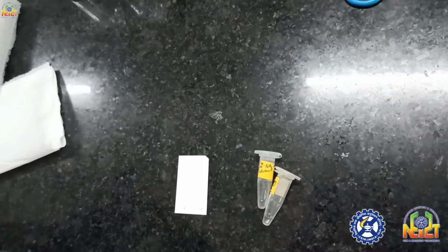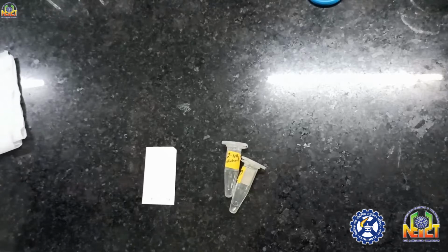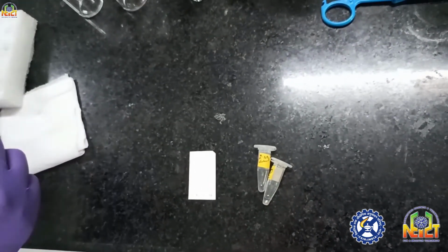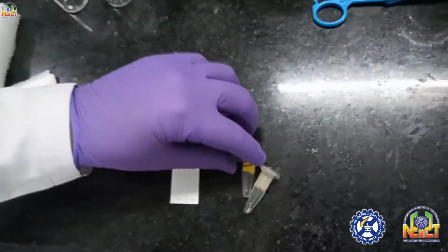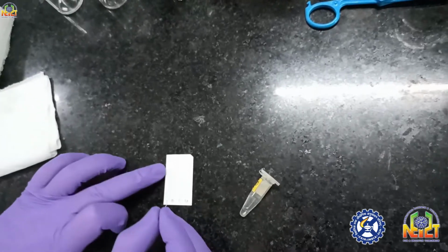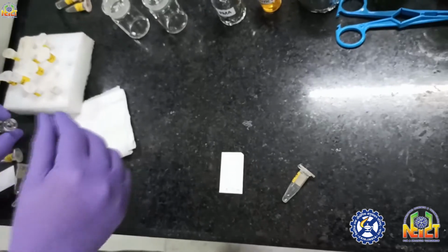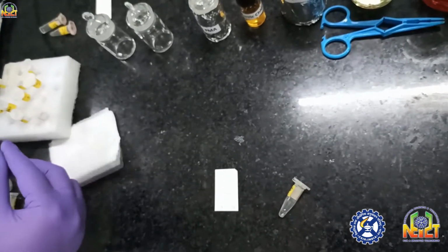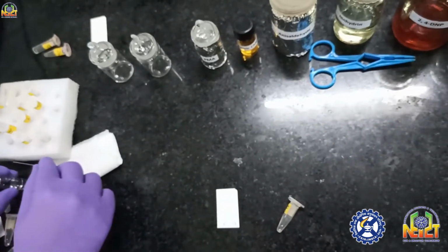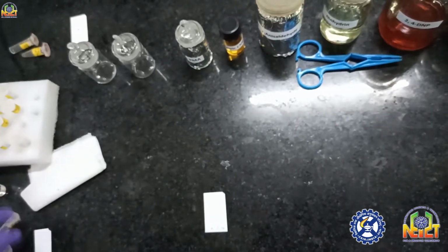If it is a concentrated spot, then it will be a difficulty, and if it is very diluted, then it is also a difficulty. All the time I am washing the same capillary with a washing solvent; here I am using ethyl acetate. You can use any solvent for this, like DCM, methanol or ethyl acetate. Before spotting a second compound, you have to wash the capillary with the washing solvent.